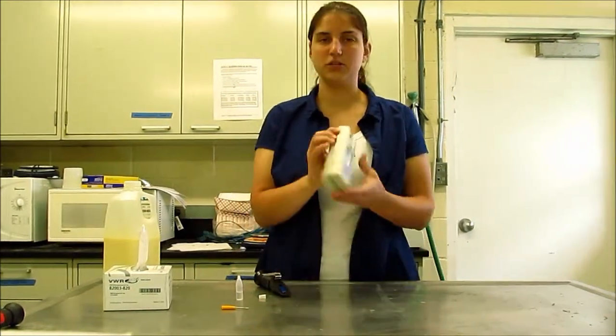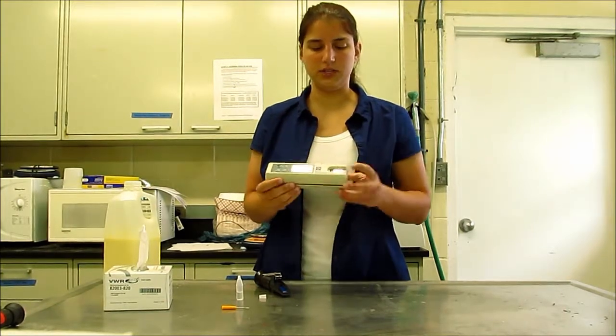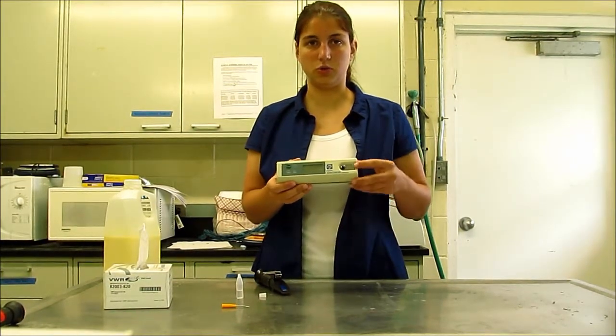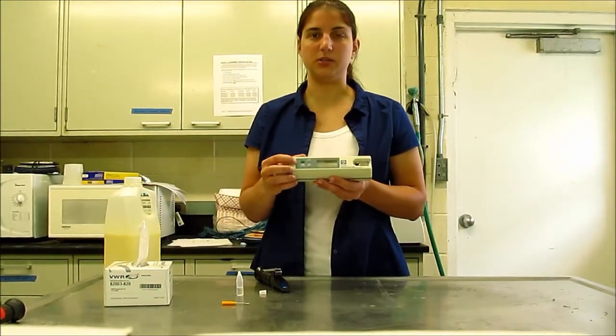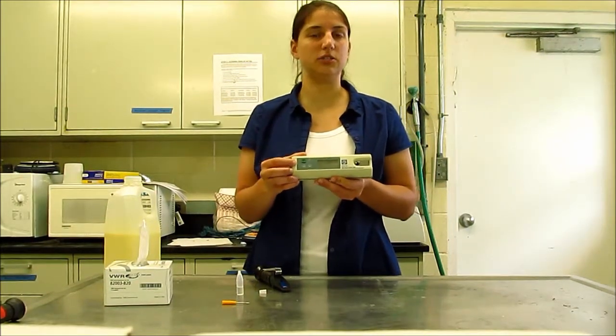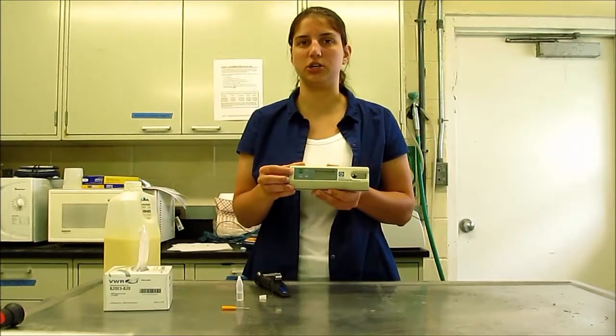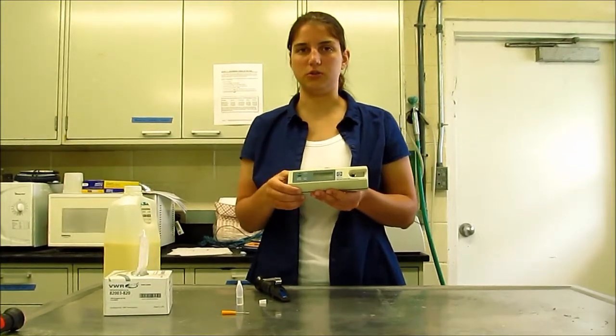Similarly, for the digital refractometer, it has a surface here where we'll put our colostrum sample or water to calibrate, and then it'll have some array of buttons. The best way to know how to calibrate a digital refractometer is to look at the instructions, because each model is going to be slightly different.